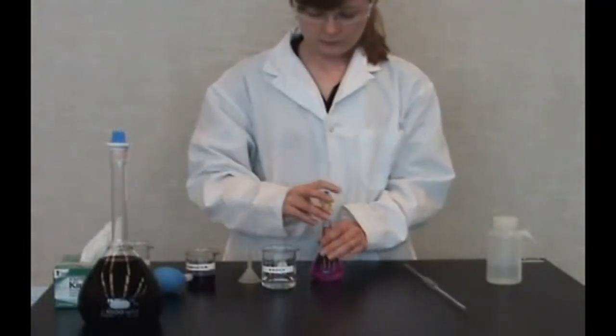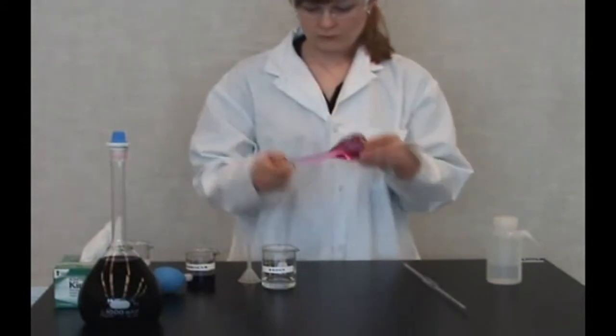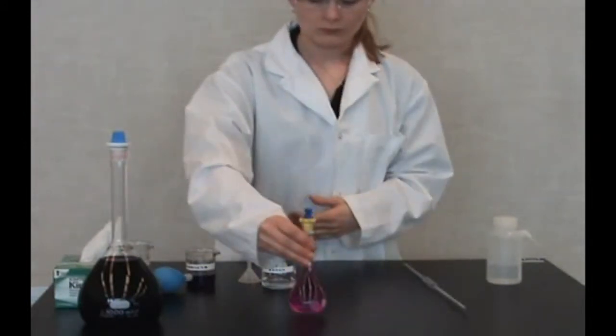Stopper the flask, invert, and swirl. Do this approximately 15 times as well.